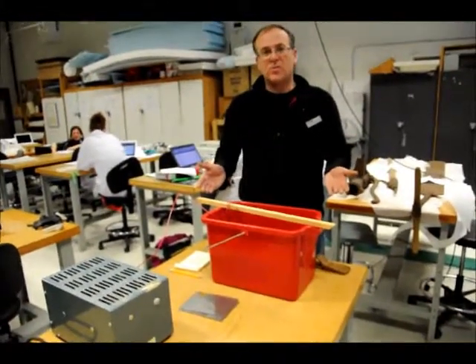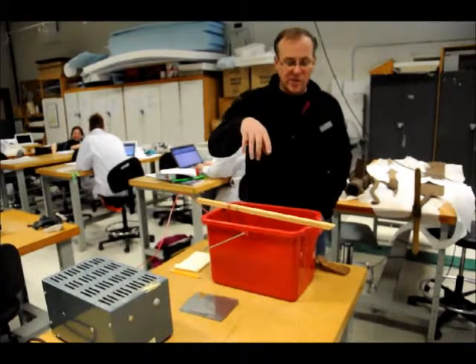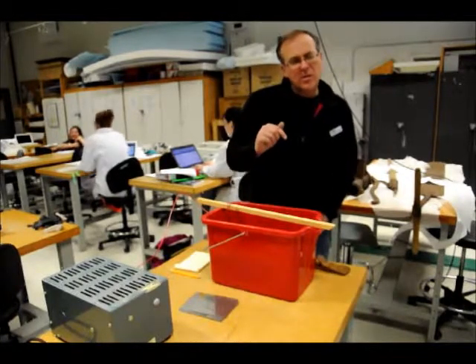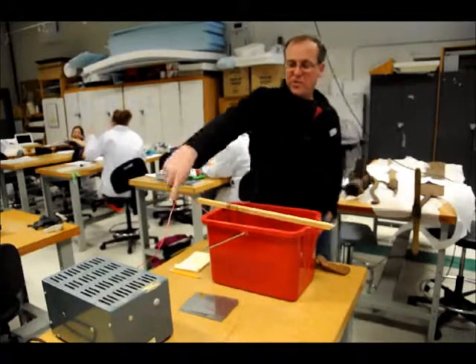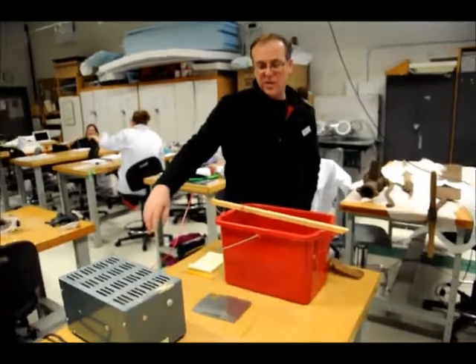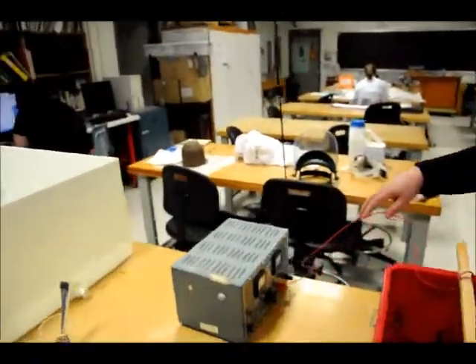Sodium hydroxide electrolysis — the electrolyte is the sodium hydroxide. What percentage solution? Two percent. We're going to swing around this way so we can see the rectifier and show people the current that we're using.